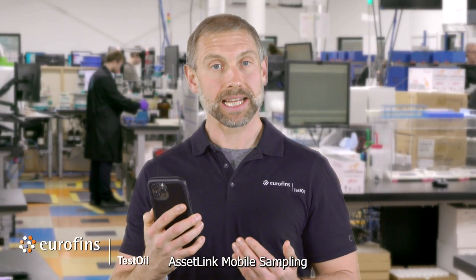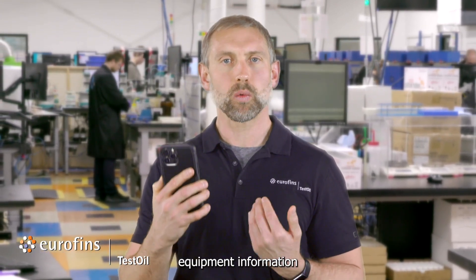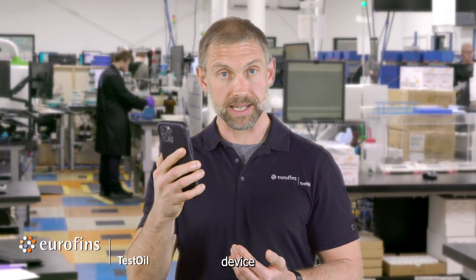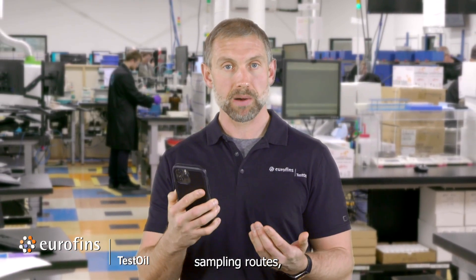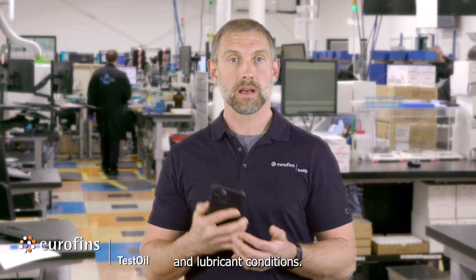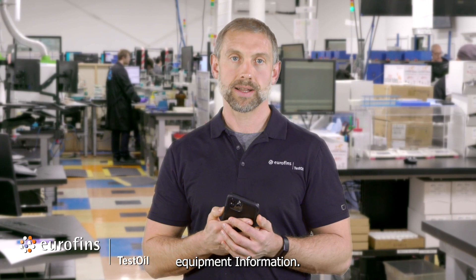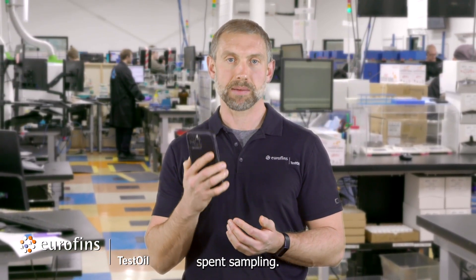Eurofins TestOil's AssetLink mobile sampling app is a tool that allows you to link equipment information to lubricant samples using your mobile device and eliminates the need to handwrite sample labels. AssetLink includes tools to manage sampling routes, provide equipment and sample feedback, view equipment and lubricant conditions, view PDF reports, and update equipment information. It is a one-stop solution to save over 50% of time spent sampling.